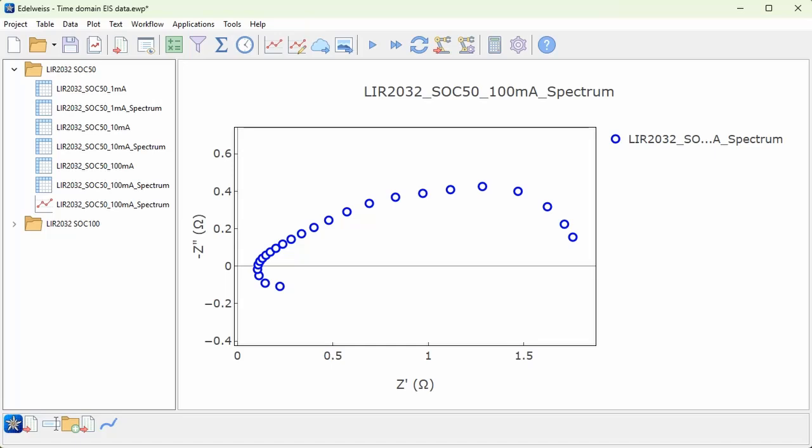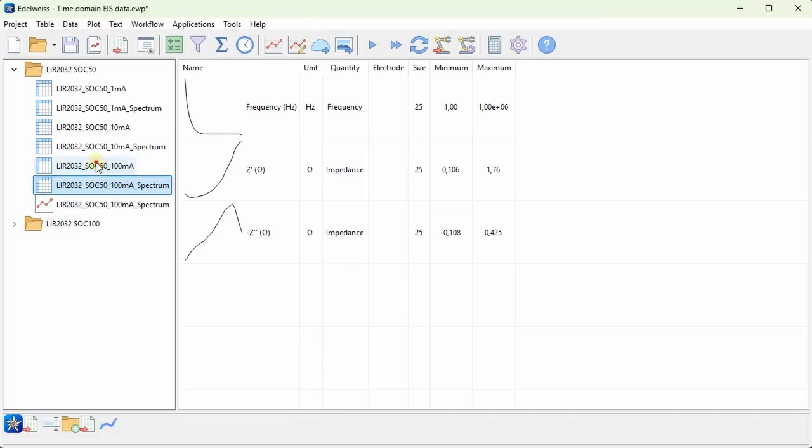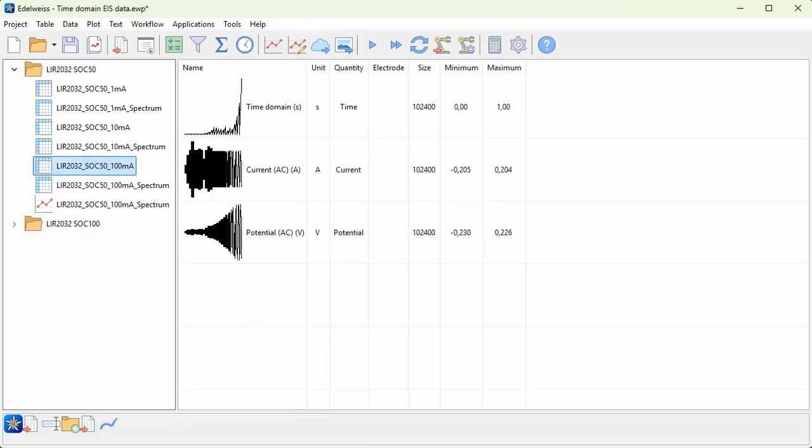And some instruments also allow you to record this underlying data in addition to the impedance spectrum. So not only this frequency domain information, which is, for example, a Nyquist plot, but also the time domain data with potential and current versus time. This data is recorded by a Metrohm Autolab device, and here you can record this data. So in addition to the spectrum, I also have this table that contains the time, current, and potential.